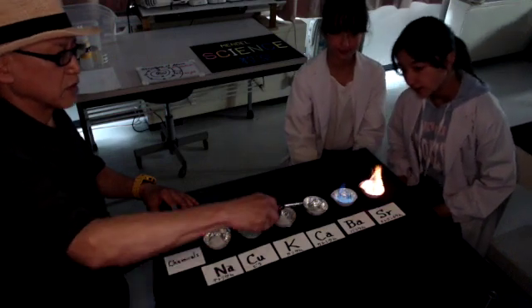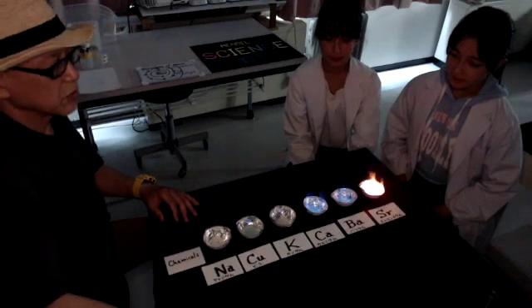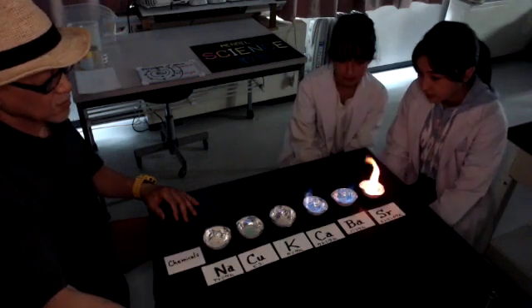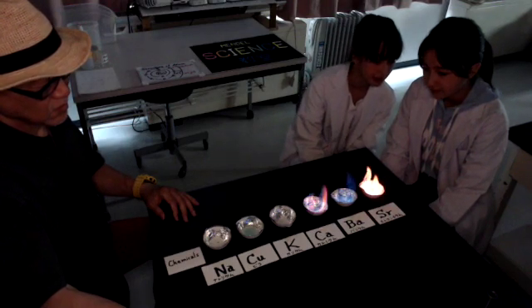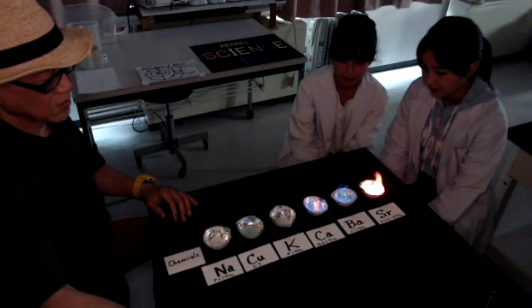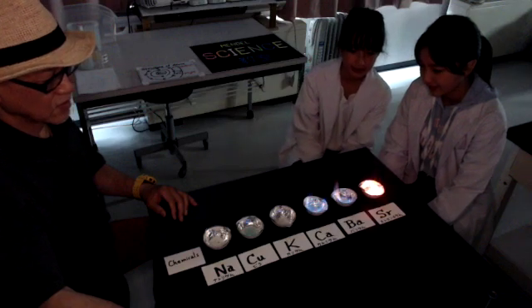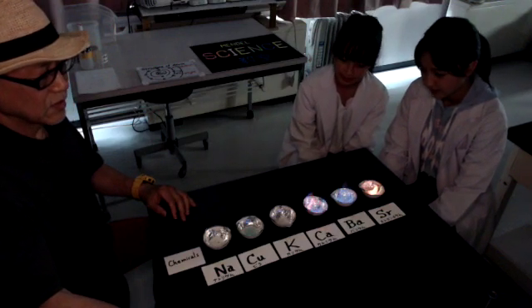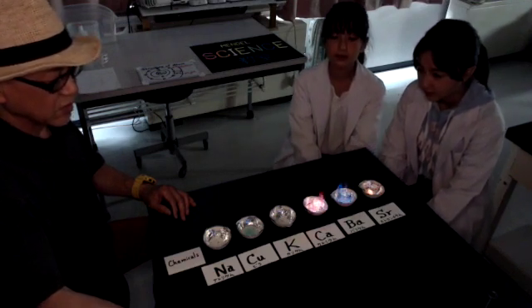Let's start. Next one. Calcium. Orange, red color light.